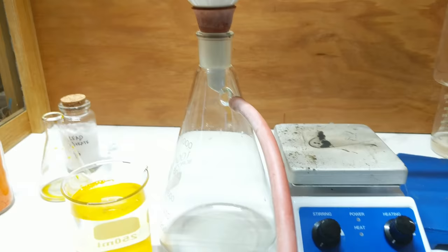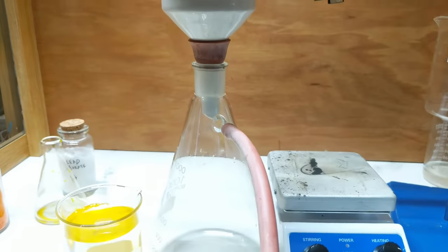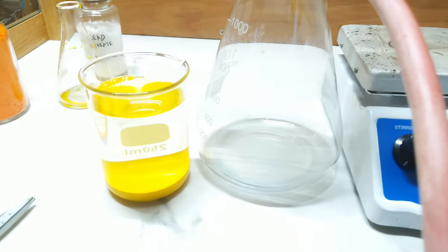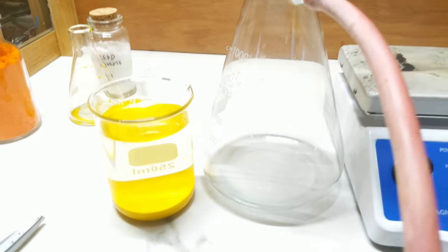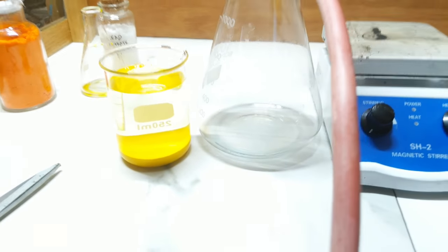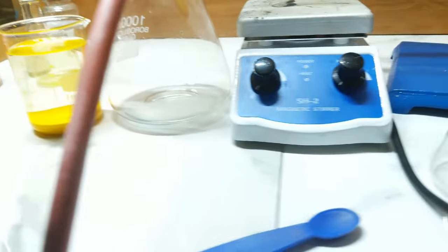So here I have a vacuum filter, which we will be then hopefully able to filter everything through. So we will flick on the vacuum filter and we will see how that goes.